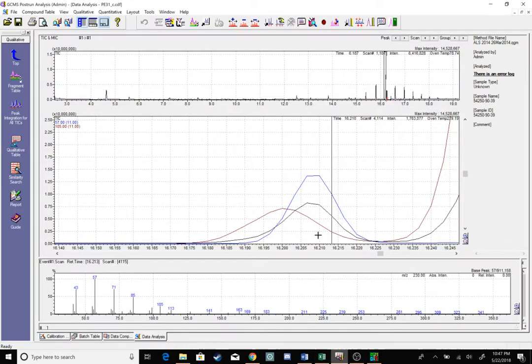In this video, I want to talk about taking Shimadzu GCMS data files, importing them into AMDIS, and then taking your AMDIS spectra, or any spectra within AMDIS, and putting that into your NIST program.